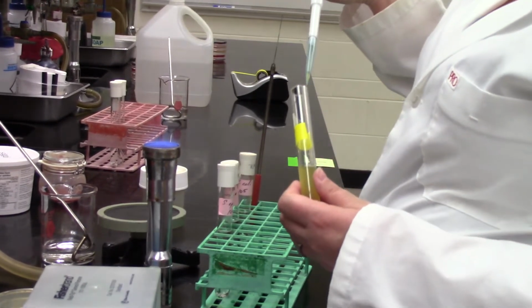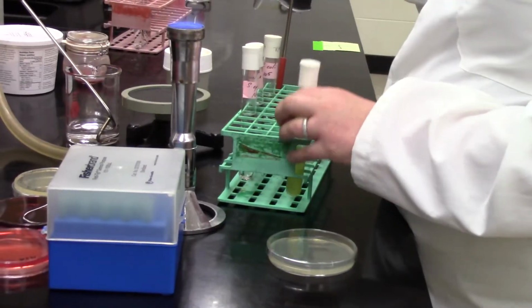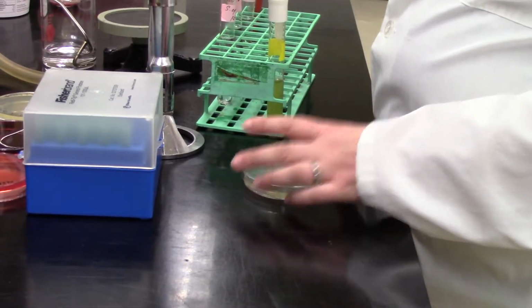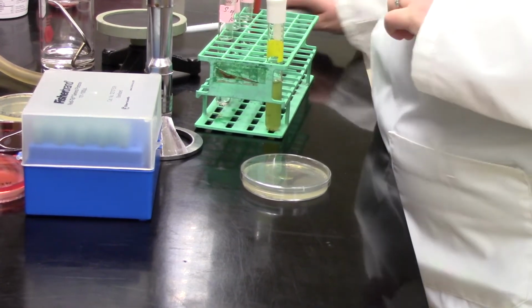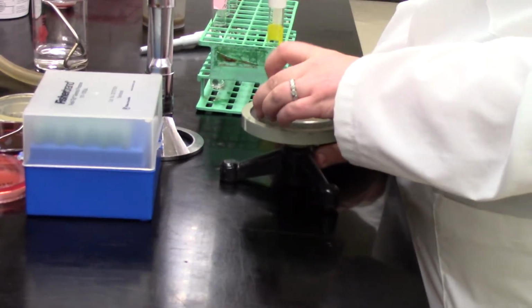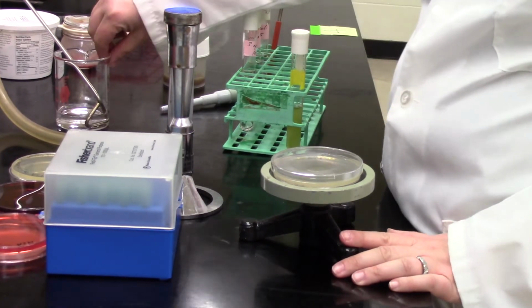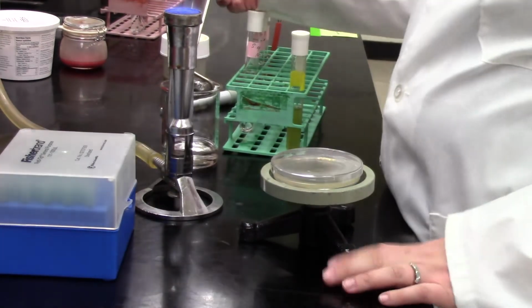I'm not going to be able to zoom in to show that exactly, but what you want to keep in mind when you're pipetting is always, does the amount I'm pulling up make sense? You'll notice when you switch from 1 mil to 100 microliters, or 0.1 of a mil, the dramatic difference in what is going up into that pipette tip. It's really not very much that you see going up with 100 microliters, and it's going to fill that pipette tip quite a lot when you're doing 1 mil.